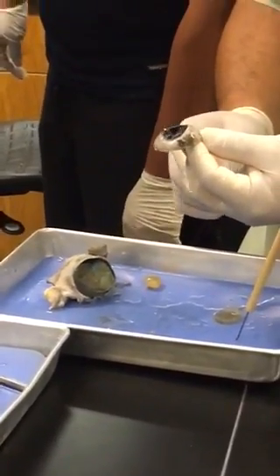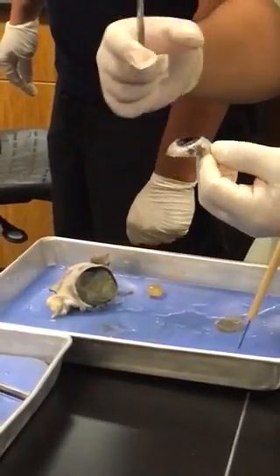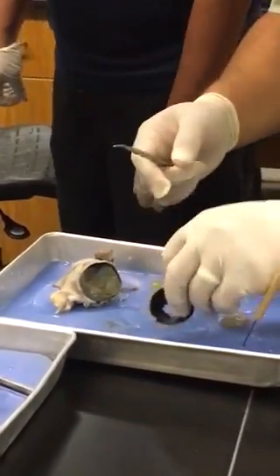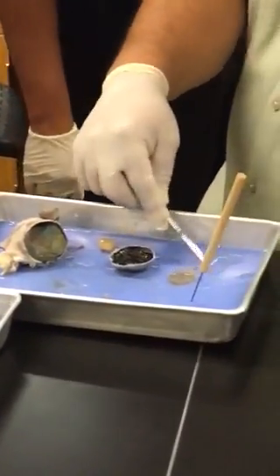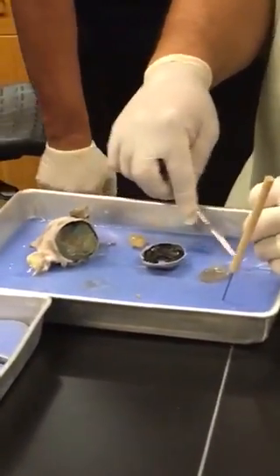What is the pupil function for? What does it allow? Light to come through, and it also regulates the amount of light. It can dilate or constrict. Identify the fluid. Aqueous. Where do you find this fluid? Anterior cavity.